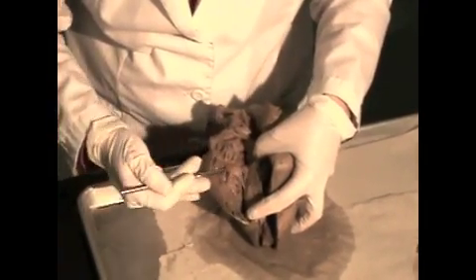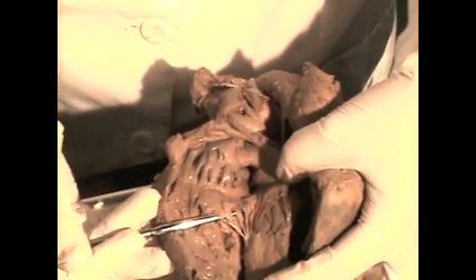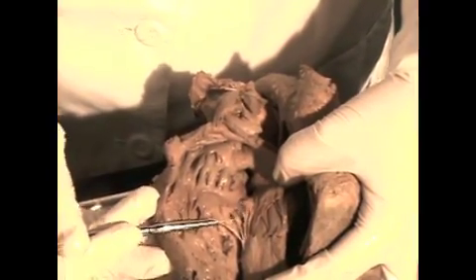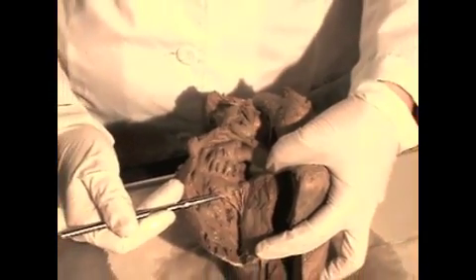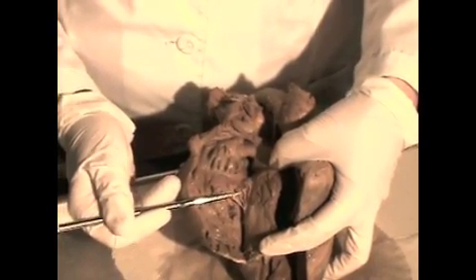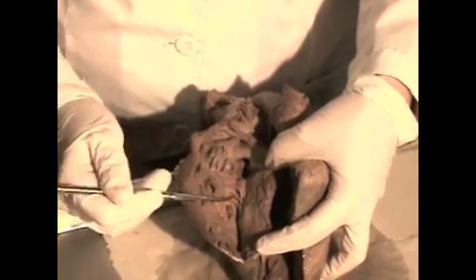And first I'm seeing this connective tissue right here with the strings on it. That's one of your heart valves. So you have valves that are called AV valves, atrioventricular valves. This is the valve itself, and it's found between the atria and the ventricles. So AV stands for atrioventricular valve. The one on the right side of the heart that we're looking at here is the right AV valve, also called the tricuspid valve. It's very, very strong.